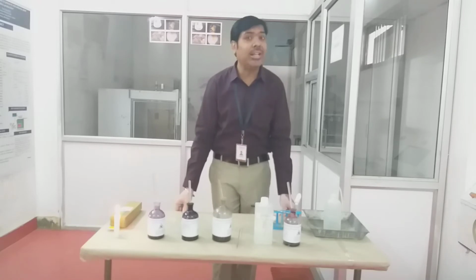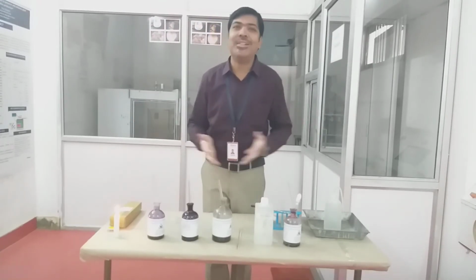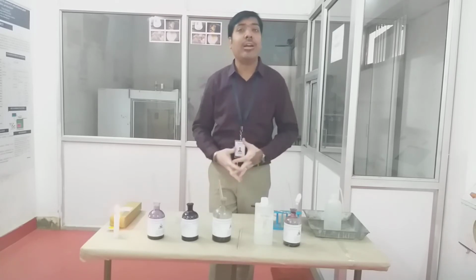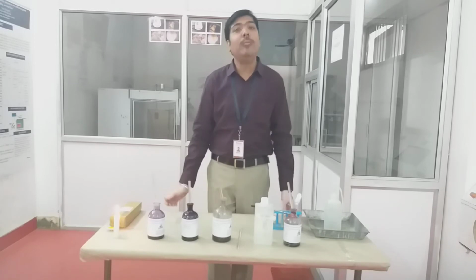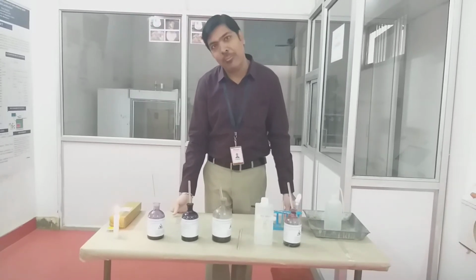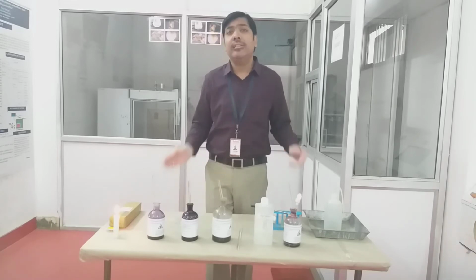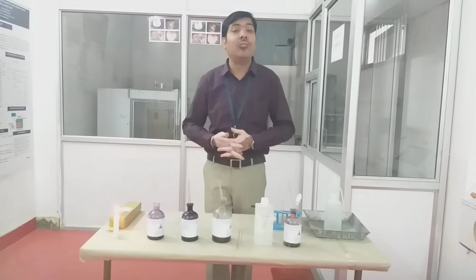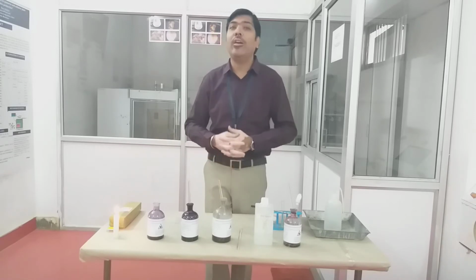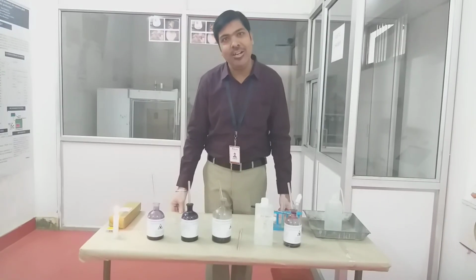As you know, in case of simple staining, it will not differentiate different classes of bacteria, but whatever microorganisms are available in the sample will be clearly visible under the microscope. You can easily identify or differentiate the morphological characteristics of the bacteria, like whether the sample consists of cocci, or has a bacillus structure, or maybe has certain spiral bodies.